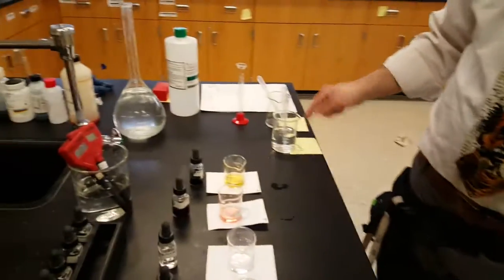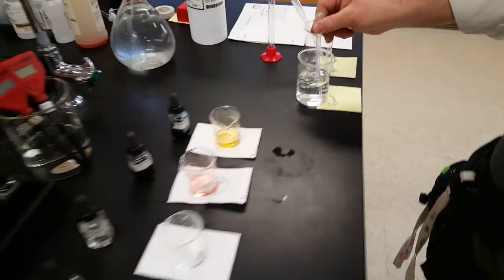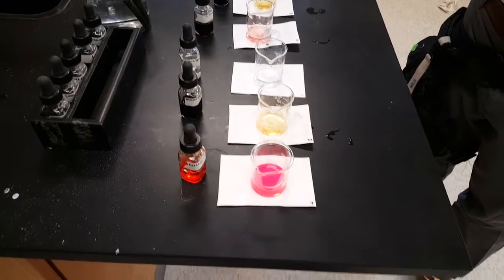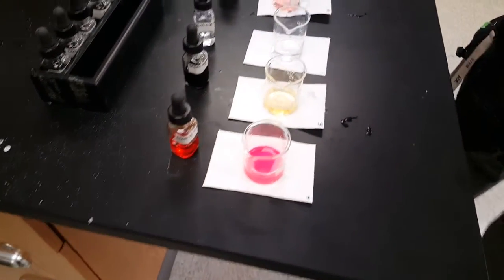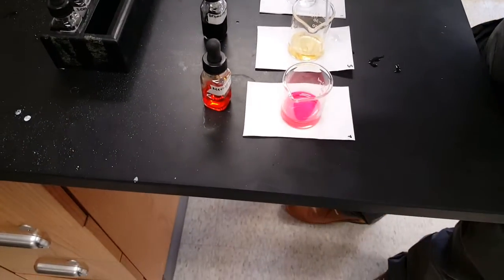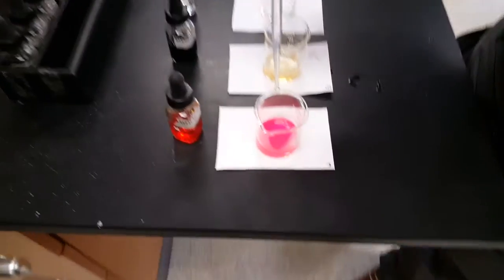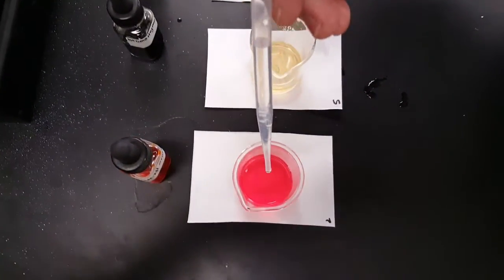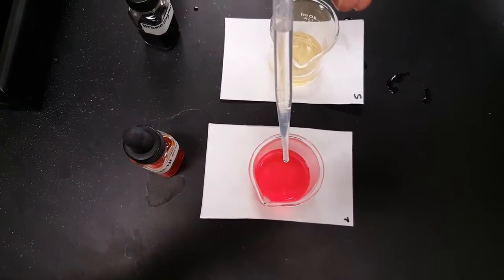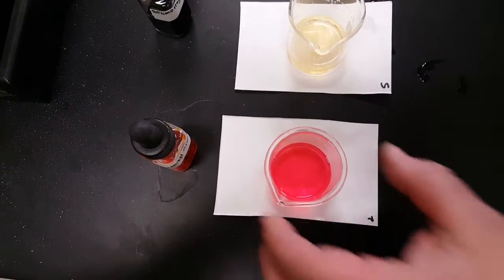So you have this acid, you've got to take some base, which we've standardized, we prepared for you, and you have to add it in as you go. I'm only going to do one of these to show you how to test it. So you get a full pipette there and you've got to go slow, 1 drop at a time. 1, 2, 3, 4, 5, 6, 7, 8, 9, 10, 11, 12, 13, 14, 15.